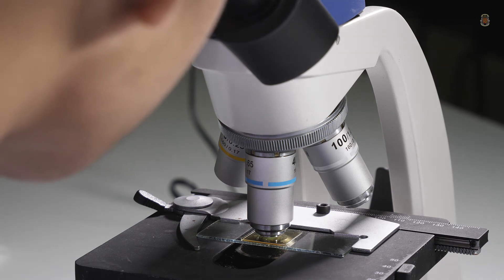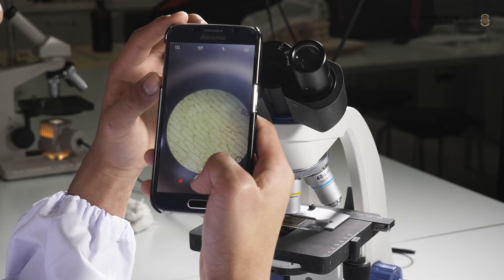Count all the cells in one field of view and record the number of those that show plasmolysis. You may also take pictures and count later.